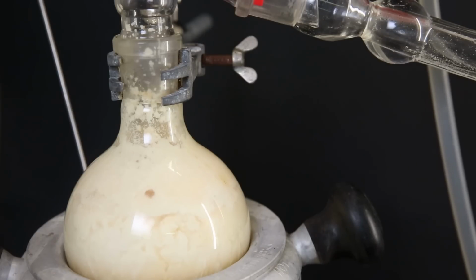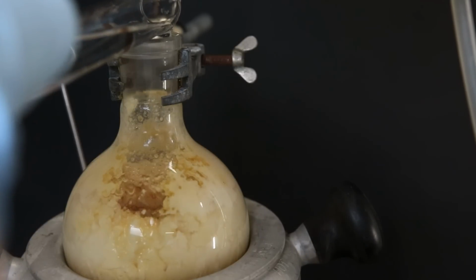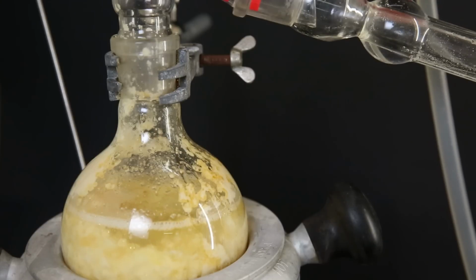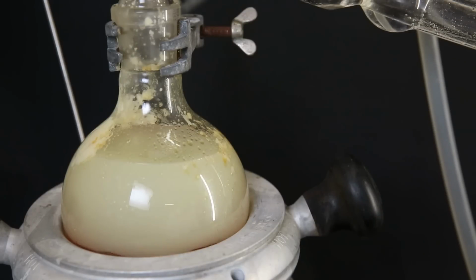So first, I had to add some water to the mixture. The water should react with any remaining enamine and convert it back into cyclohexanone and pyrrolidine. And after adding the water, I was very relieved by what I saw. All of the solid stuff luckily started to disappear, dissolving into the water. And now, I was left with 2 layers.